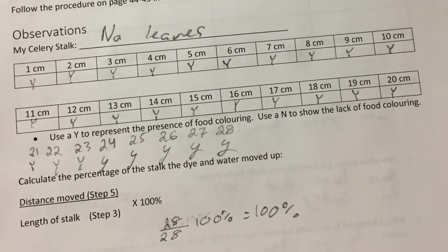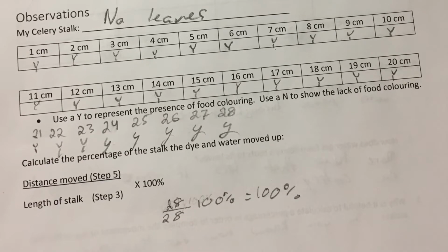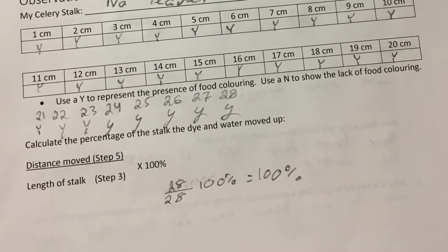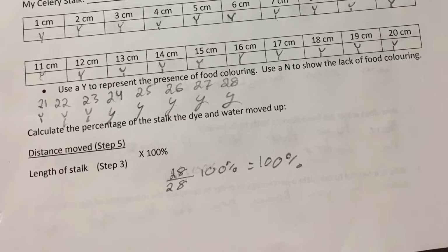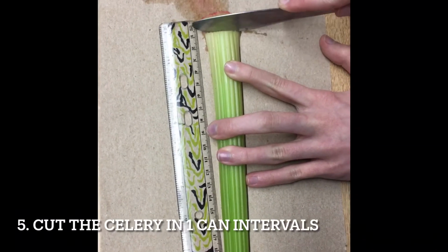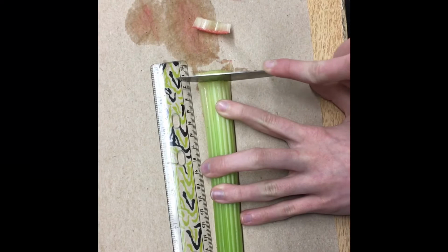We then recorded the length of the stalk on the sheet, and all the Y's that you saw on the sheet were cases where the celery had red dye you could see in the veins, and you'll see that coming up. So what we're doing right now is cutting the celery in 1 centimeter intervals and looking to see whether or not you can see the red dye in the little veins.